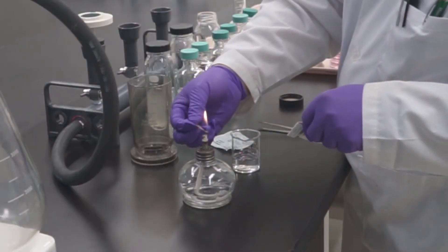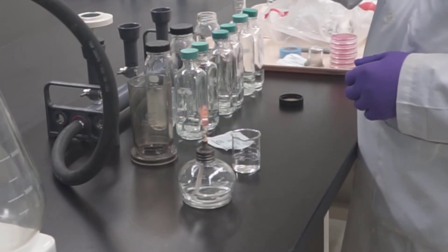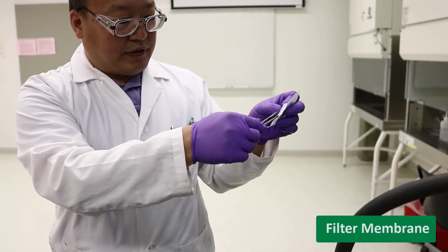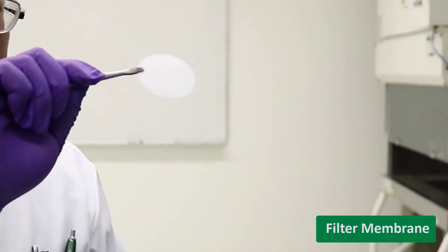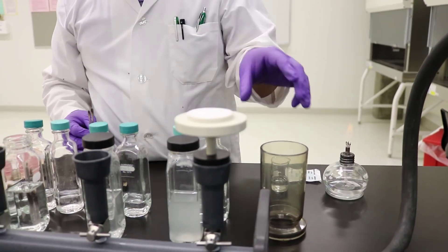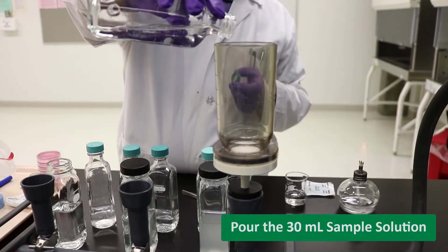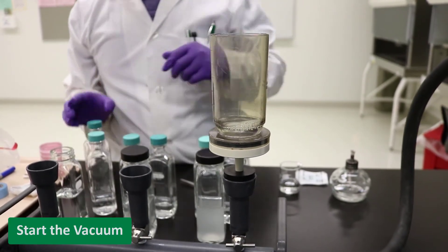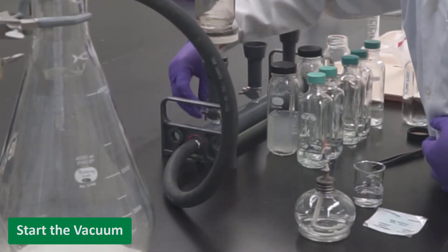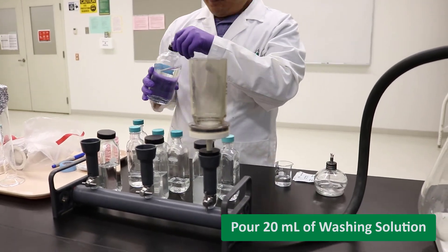Take forceps and dip them in an alcohol solution. Ignite the alcohol burner and hover the forceps over the burner to sterilize them. After cooling down, use the forceps to take the filter membrane from the sterile package and put the filter paper on the filter unit. Make sure the grid side of the filter paper is facing up. Pour the 30 ml sample solution into the filter cup and start the vacuum to begin filtering. Pour in about 20 ml of washing solution to wash the wall and make sure all cells are on the membrane.